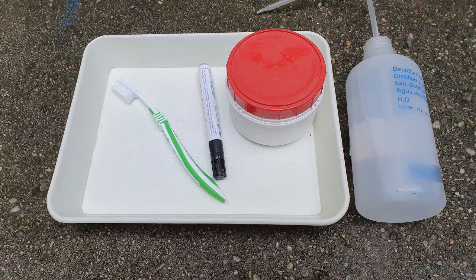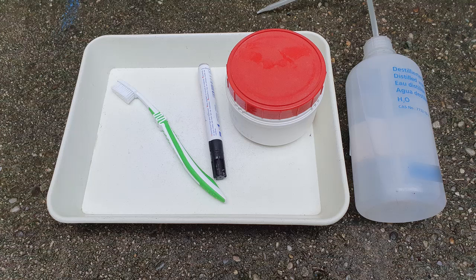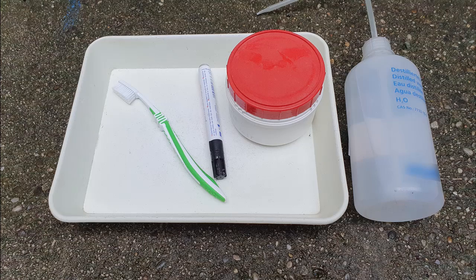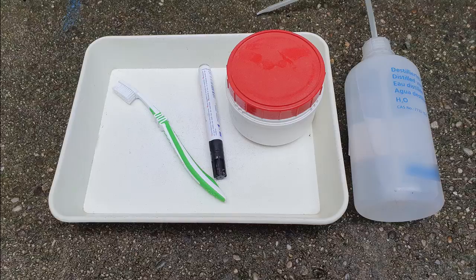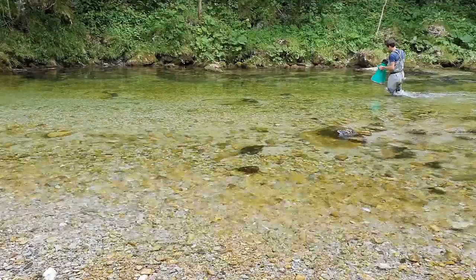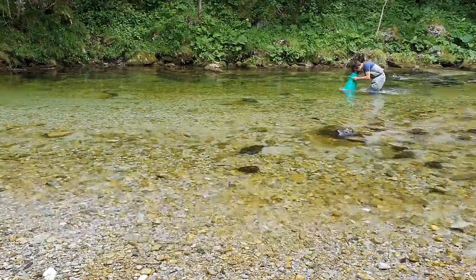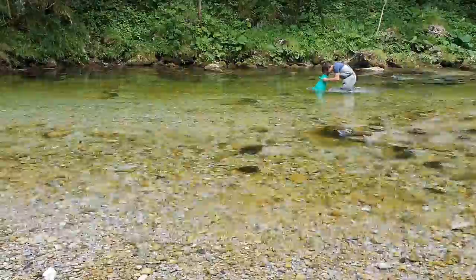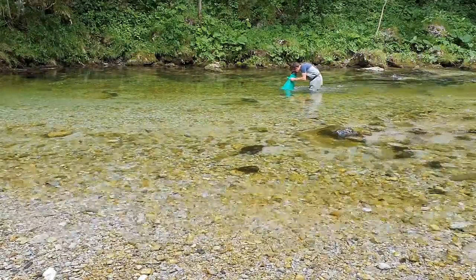The basic sampling equipment for collecting diatoms includes a stiff toothbrush to remove the biofilm from the substrate, a wide plastic tray to collect the biofilm, a sampling container, a wash bottle, a permanent marker and an aquascope. The aquascope — a box, bucket or tube with a glass bottom — is useful for finding suitable substrate and evaluating the state of the algal biofilm without necessarily lifting the substrate from the water.